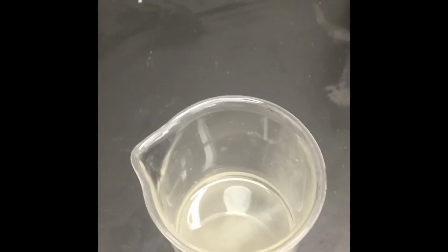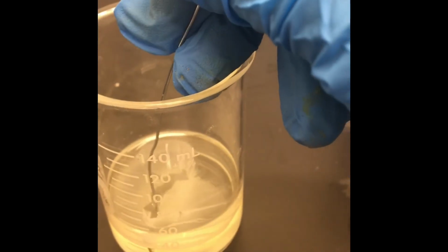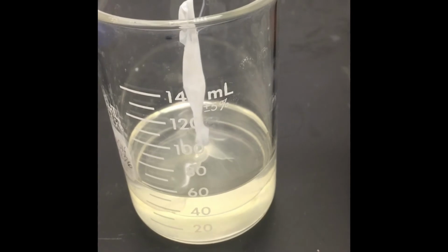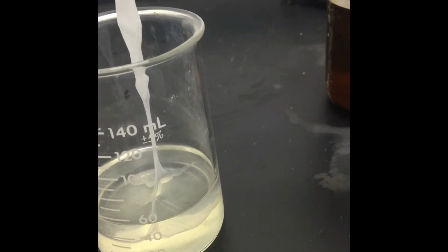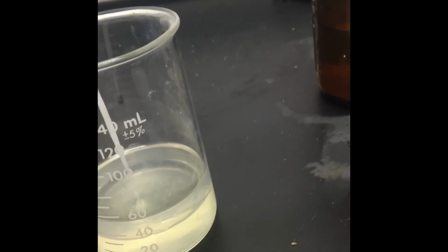And what I'm going to do is start pulling it out. So you can see that in this situation we have 2 liquids that are going to form a solid. So I'm going to move this back a little bit. I'm going to use just this paper clip. I'm kind of like fishing. Oh, look at that. Fishing for my nylon. Again, it only forms in the boundaries between these 2 liquids. And I'm going to start pulling it. What I'm actually pulling is the nylon that is formed between these 2 compounds. Now, how much am I going to be able to get? Well, I'm going to be able to keep doing this until I run out of one of those liquids.